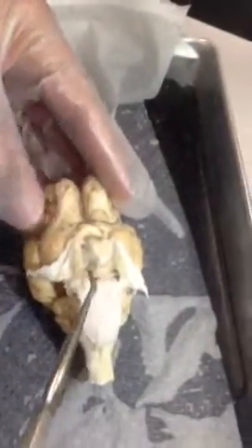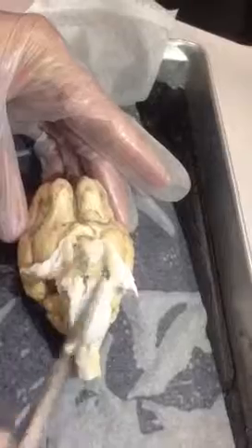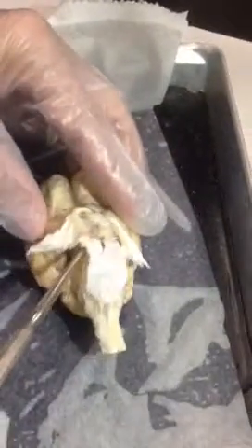From the outside, you can see the pons and the medulla. I'm going to flip the brain over so we can see those structures on the lower portion. And here's the inferior view of the sheep's brain right now. The pons at this moment is partially covered by this flap of tissue, but these enlargements right here would be the region of the pons.